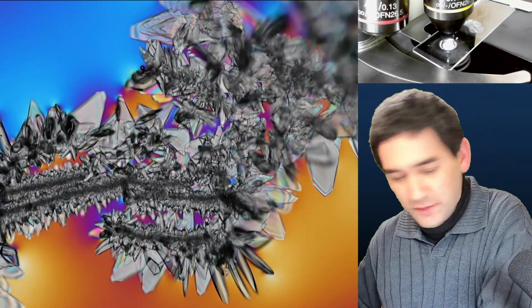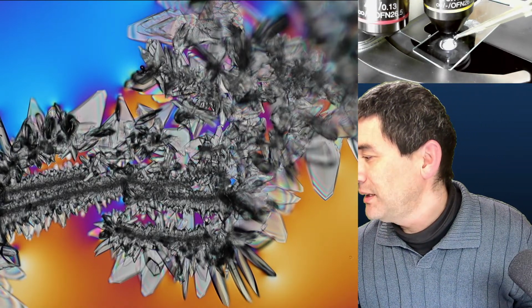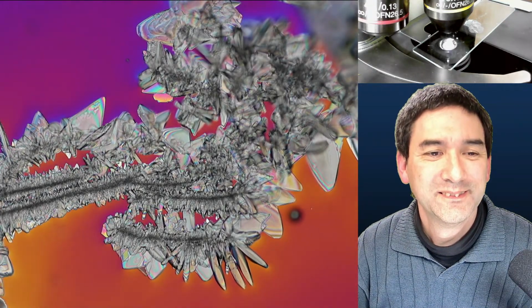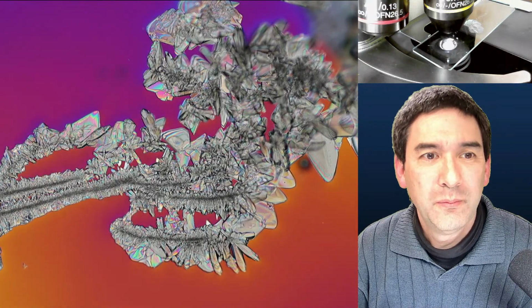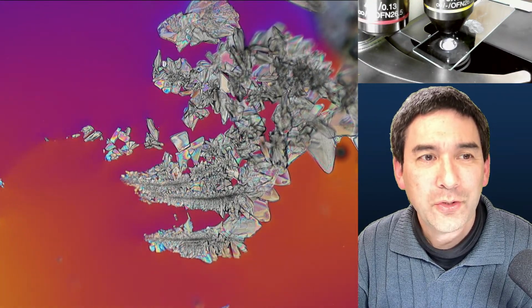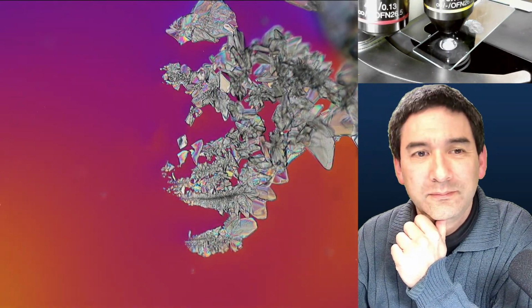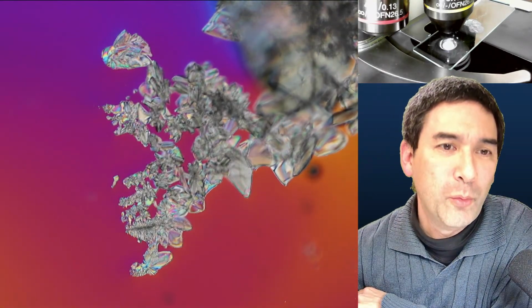And because it's so fun, you know what I'm going to do? I'm going to end up destroying it again by adding a little bit of water. So let's see. And everything's melting down again. Because by adding water, of course, it's further away from the saturation point. And it's starting to dissolve. So several years ago, I've made quite a few nice pictures that I put up on my wall, using crystals.